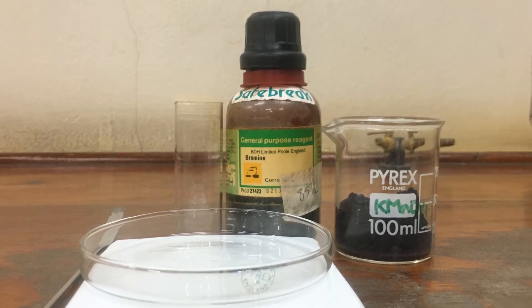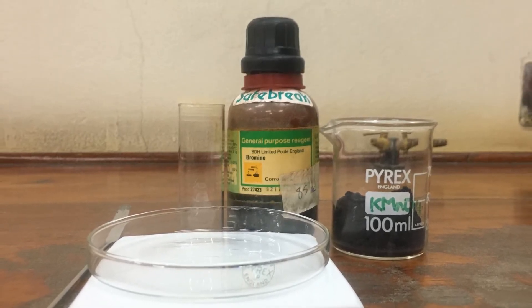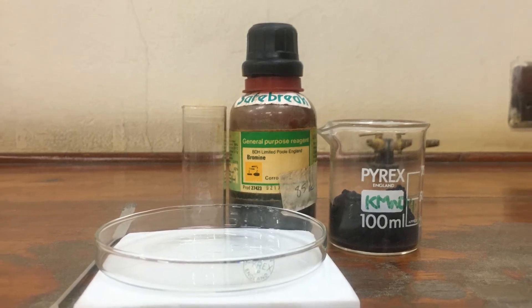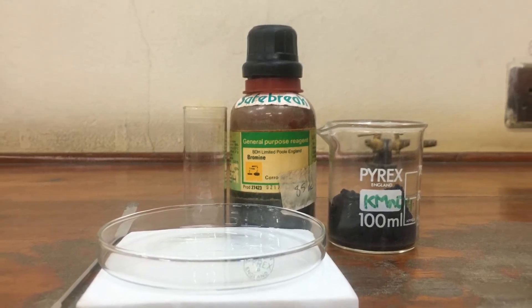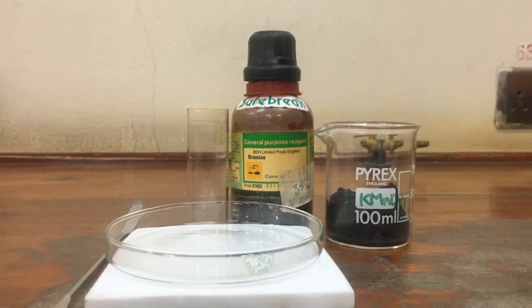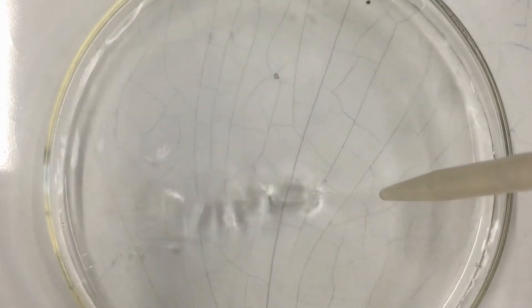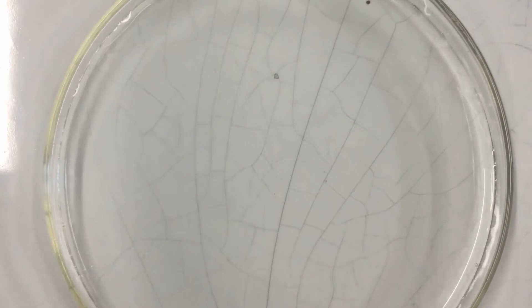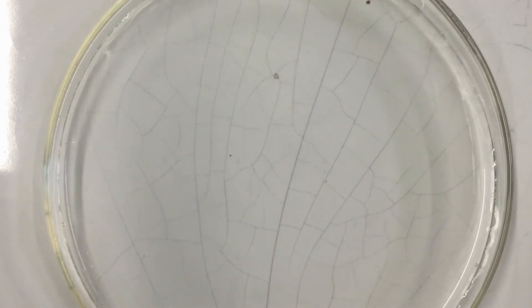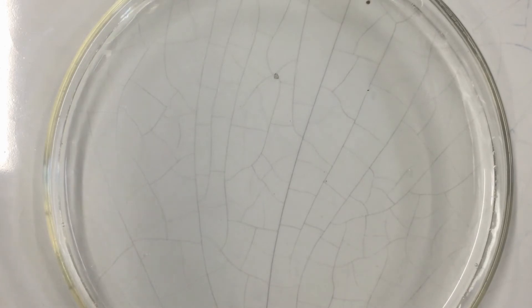This is a picture of the chemicals and glassware that we are working with today. The first thing we are doing is filling the petri dish with distilled water and then adding a few crystals of potassium permanganate.